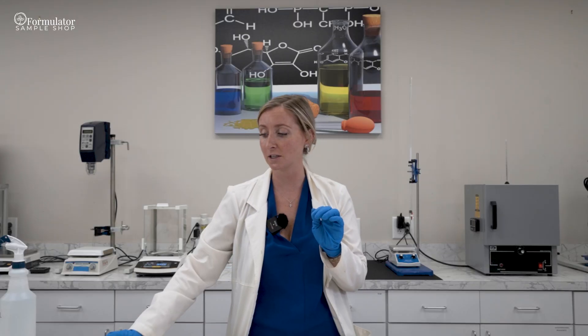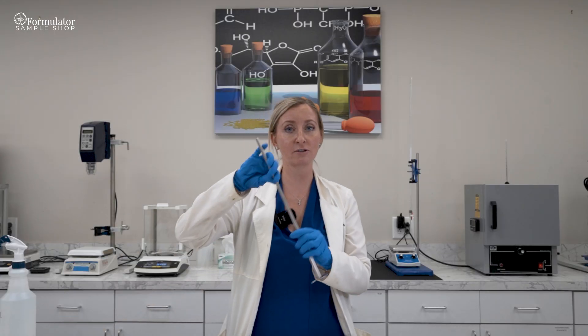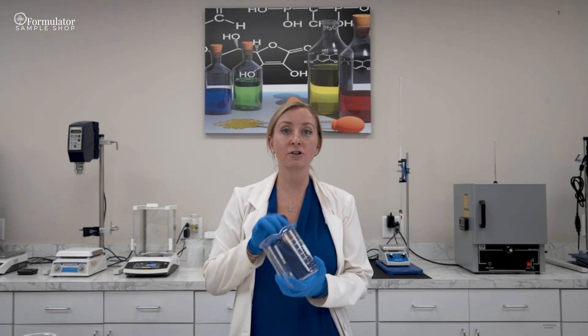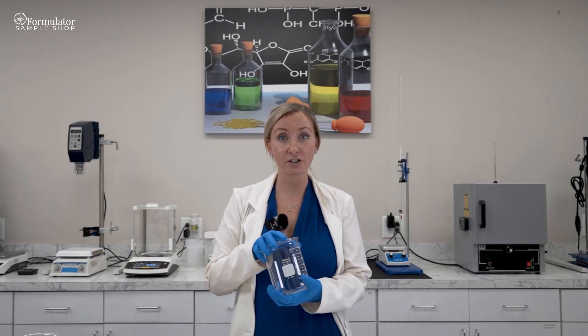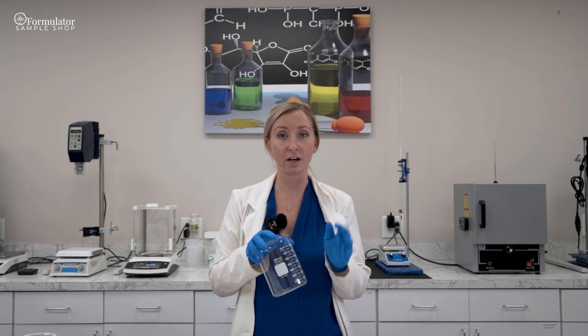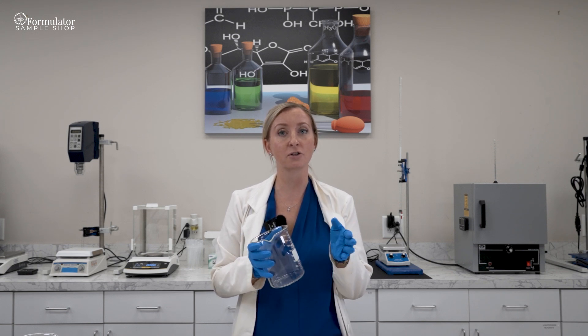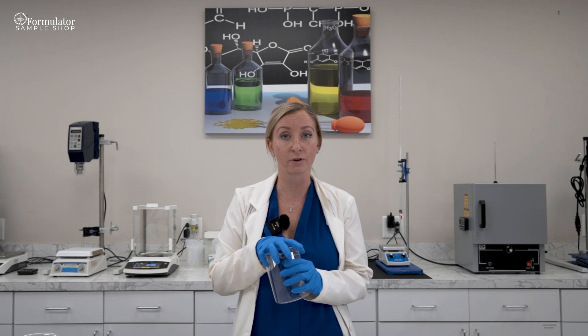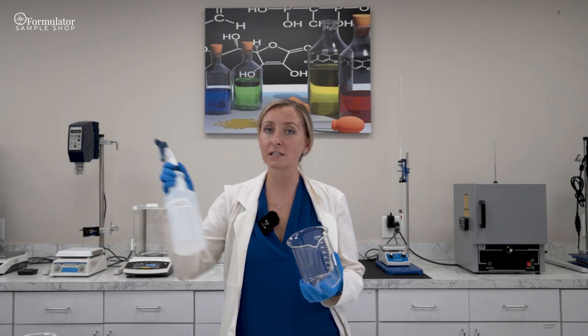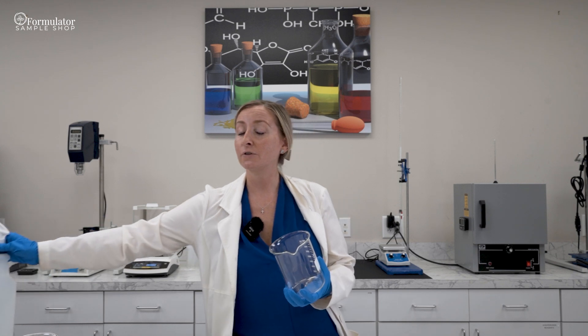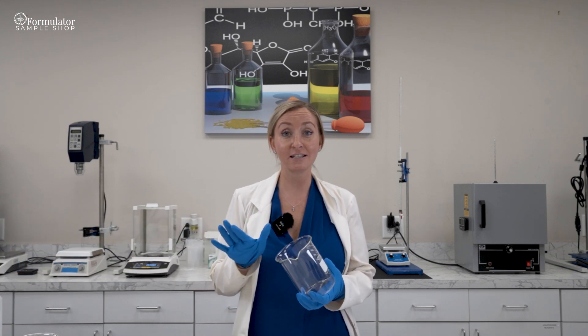As well as mixers such as this. When you're working with glassware, you always want to make sure that it's clean before you make your batch. If you have a dishwasher, that's great. You can put your beakers straight in the dishwasher and make sure that they're sterilized before use and dry before you start your batch. Always spray it with alcohol.